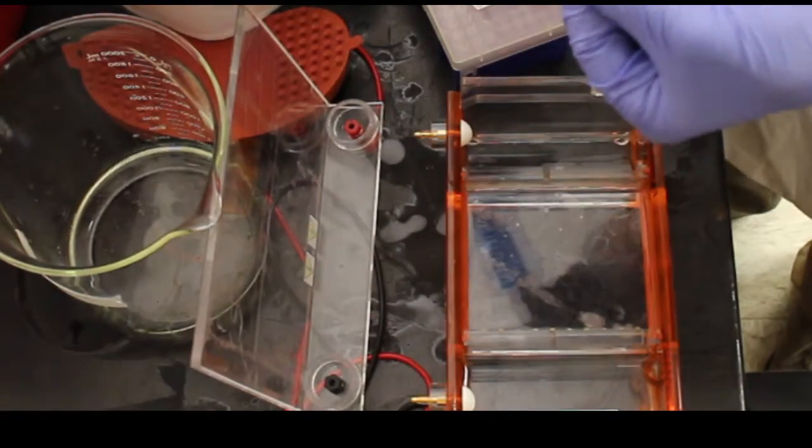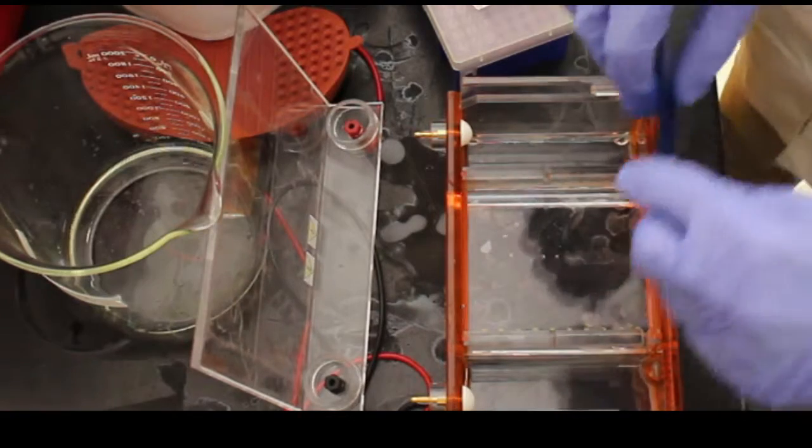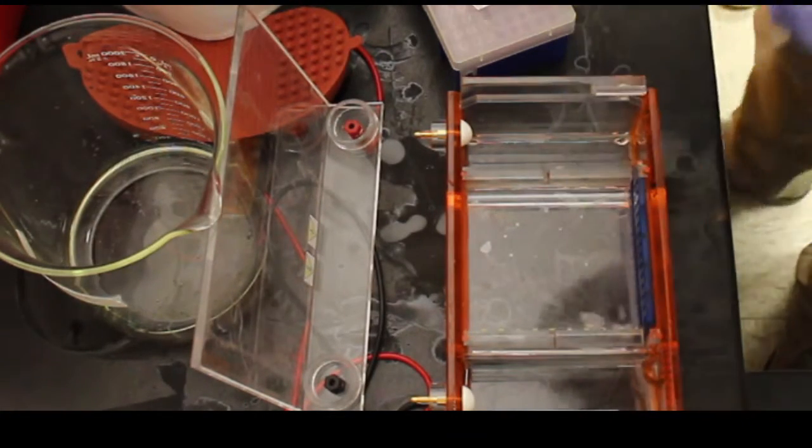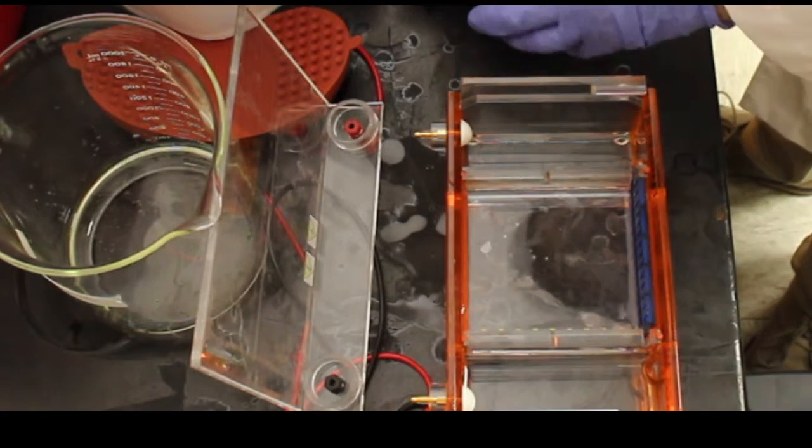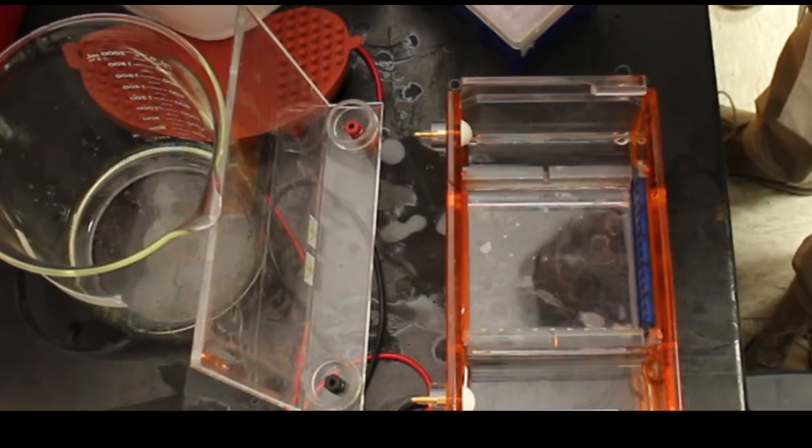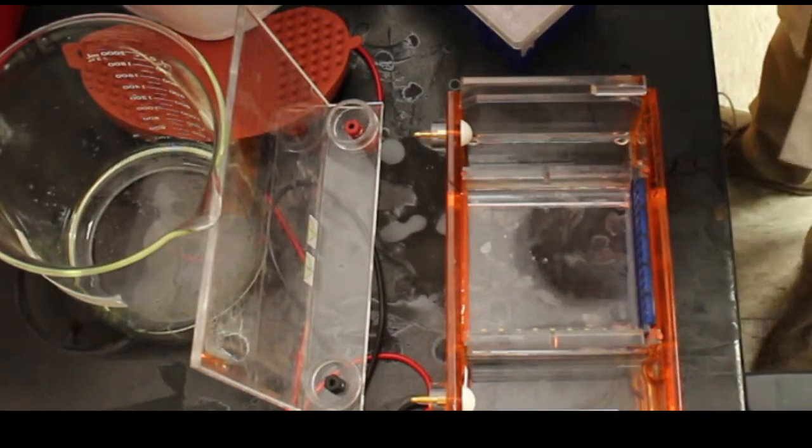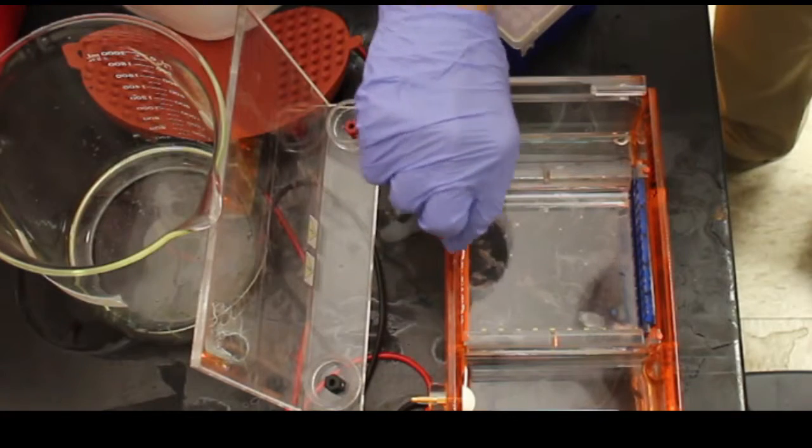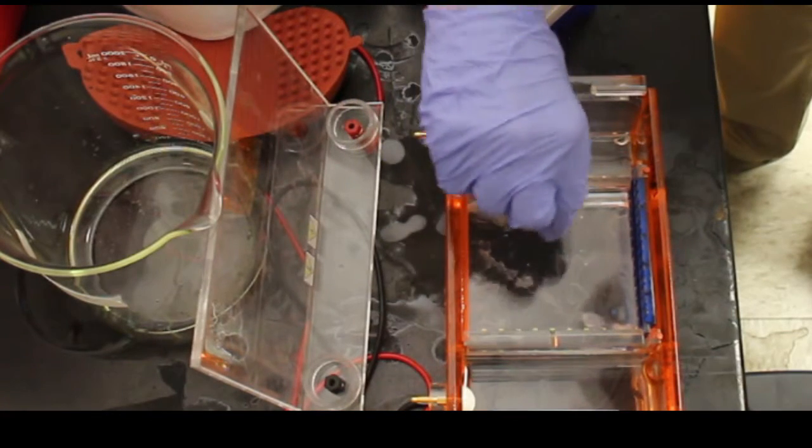Place a well mold into the gel solution. It's important to always clean this mold between uses as contamination may be visible when imaging the gel. Using a clean pipette tip, carefully push bubbles within the solution towards the mold walls. This removes the bubbles and ensures that the gel will be solid throughout. Be careful not to breathe any of the fumes coming from the agarose gel as some ethidium bromide may have been vaporized.